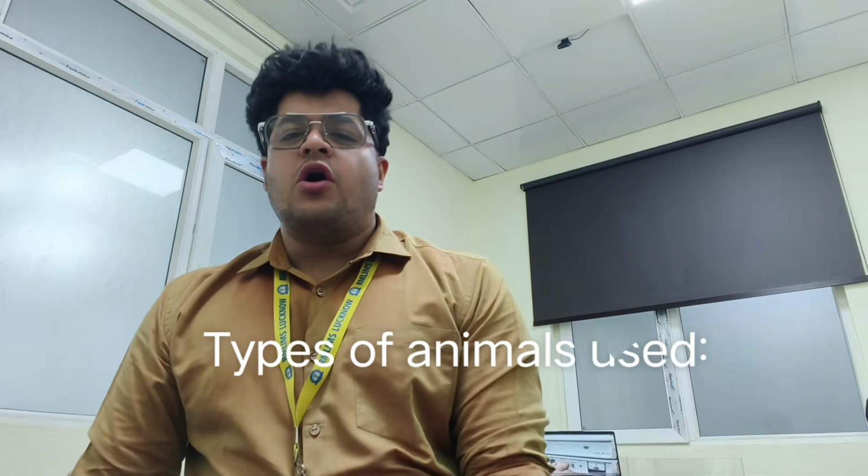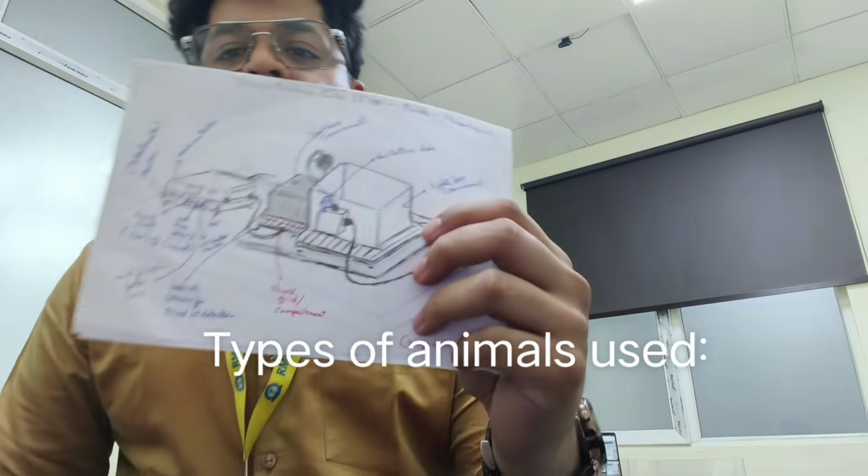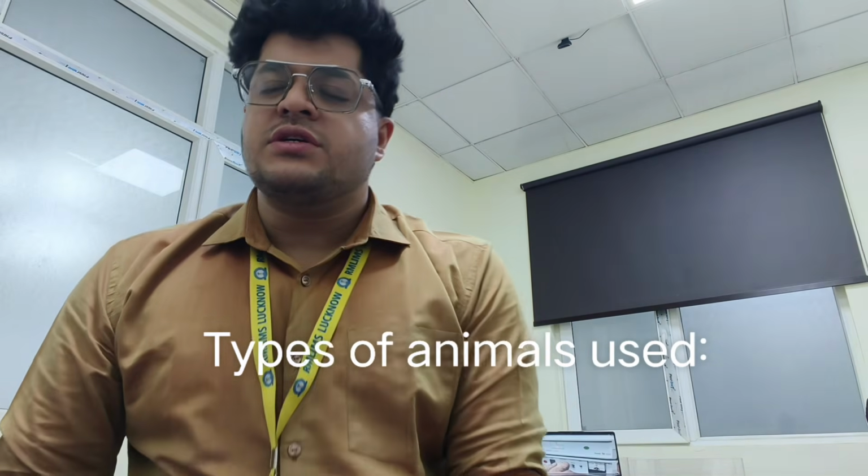Before we start, let us briefly have a look at what type of animals we use. In this experiment, we use either mice or rats. If we are going to use mice, then we use Swiss albino. Generally, each mouse weighs between 20 to 30 grams. And if we are using rats, then we can use Wistar or Sprague-Dawley rats, weighing between 150 gram to 250 gram.